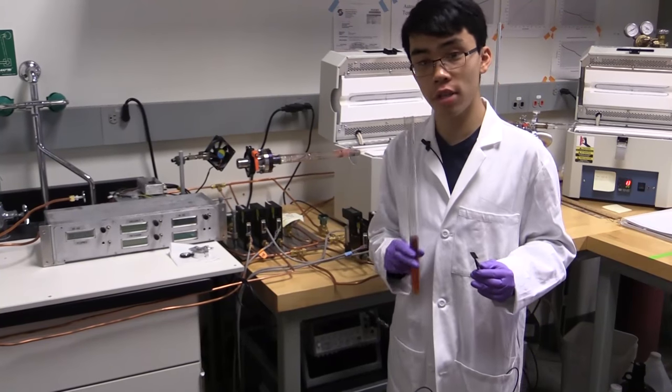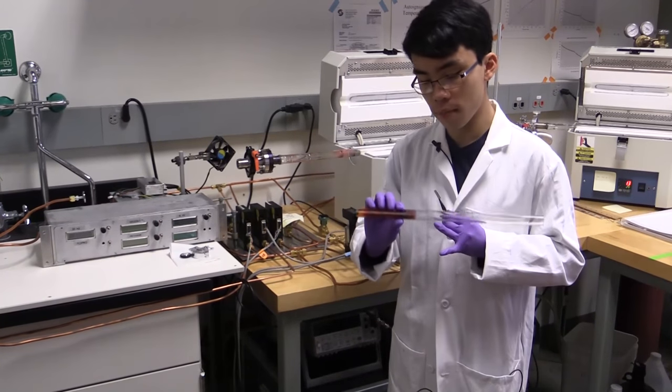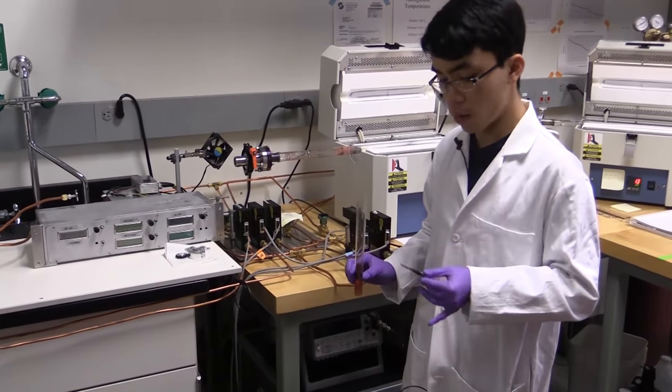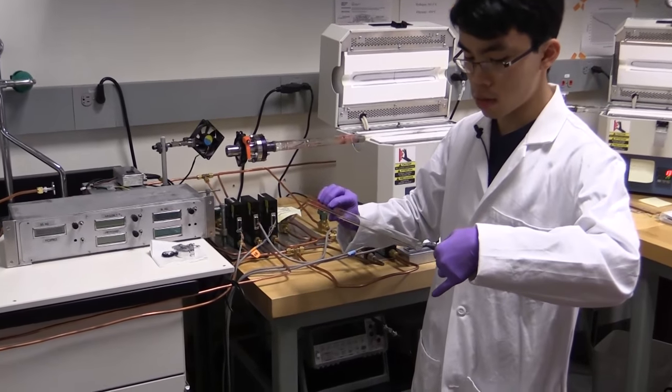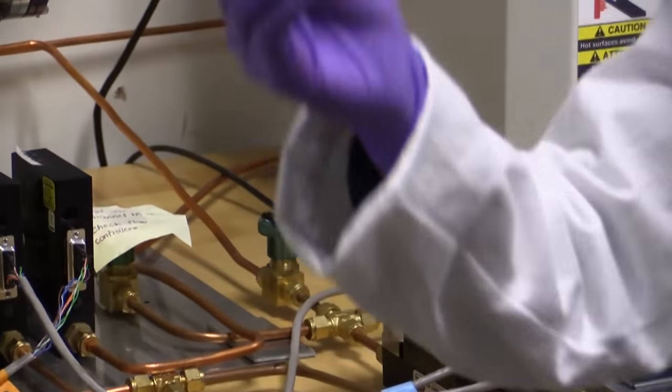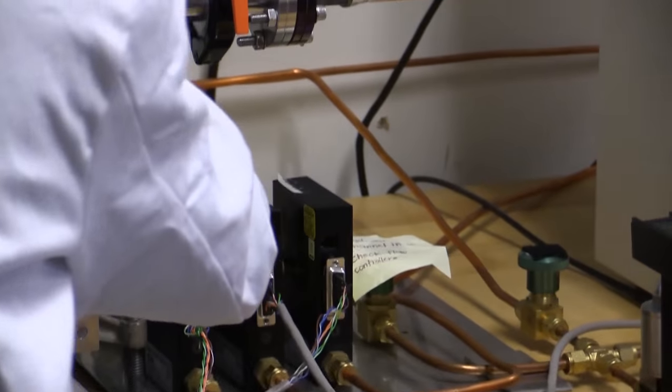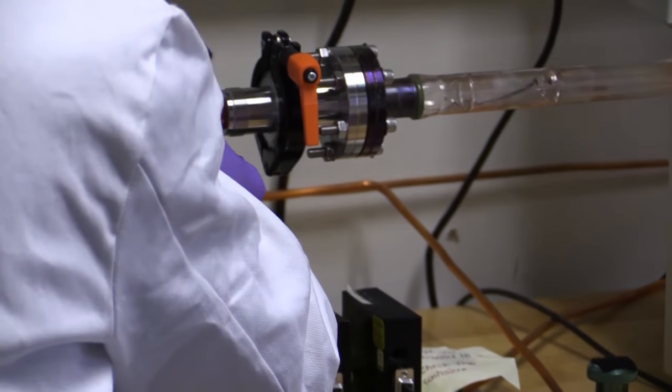Here, we have a quartz inner tube that has obviously been used before. Here, we just see the selenium that has been deposited, and we are just going to load our substrate. I happen to know that putting it here, we will put it very close to the center, and we will just load it into our outer tube.